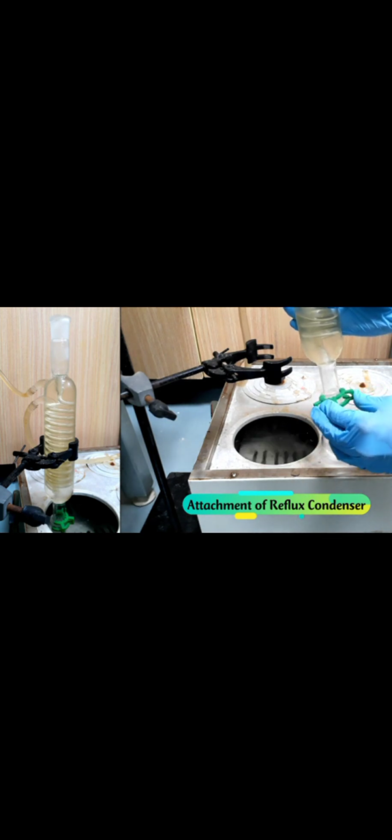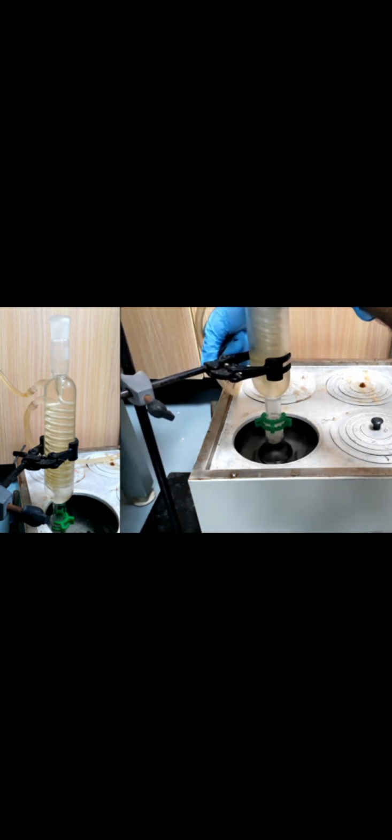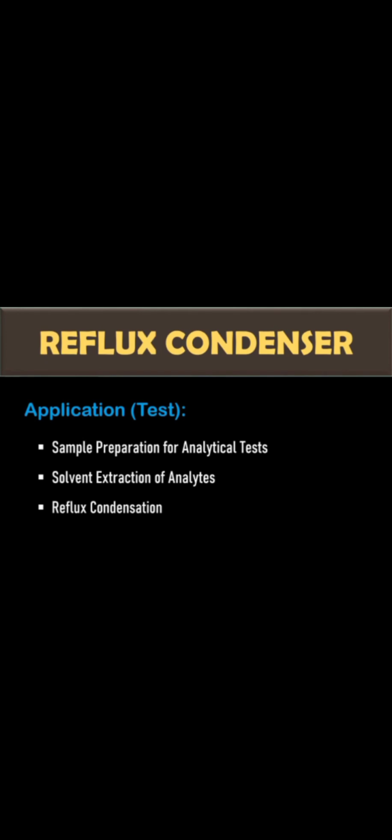Reflux condenser. The reflux condenser is set up in a way that cold water can run through it as it condenses vapor into liquid. The major source of heat for a reflux condenser is usually a heating mantle or a water bath. This is essential because the temperature is regulated to suit the temperature of the solvents in the sample. A reflux condenser is mainly used in sample preparation. It's also used in solvent extraction or in any analysis that requires a reflux condensation.